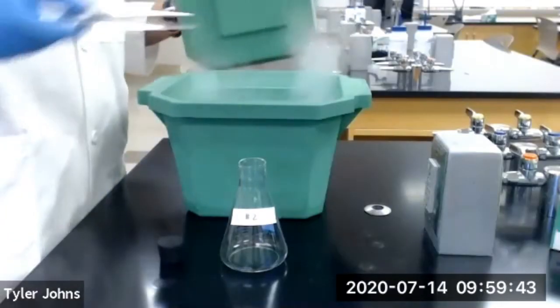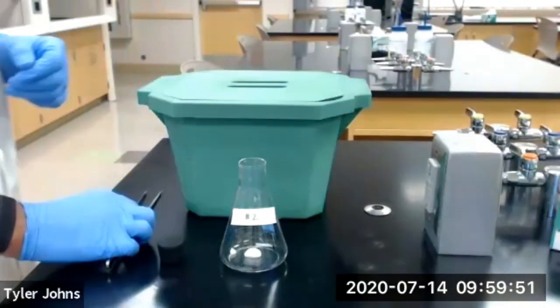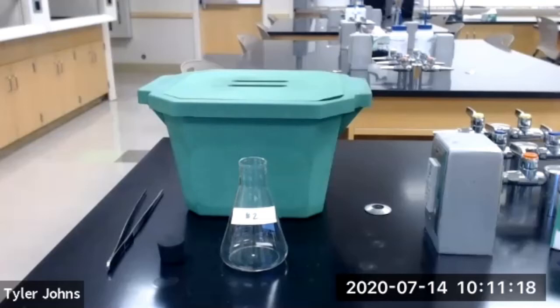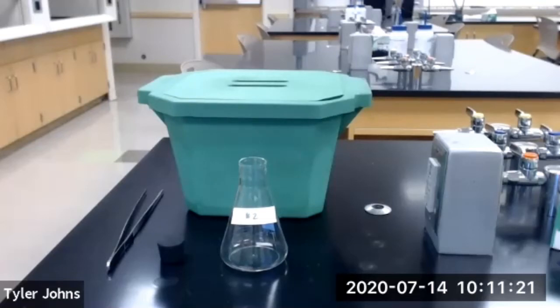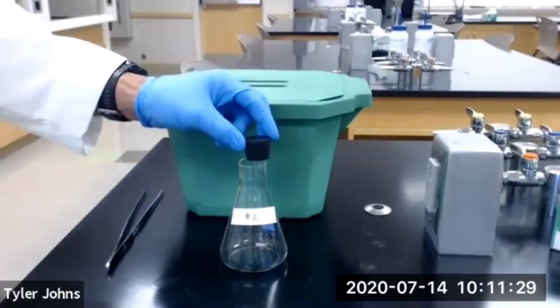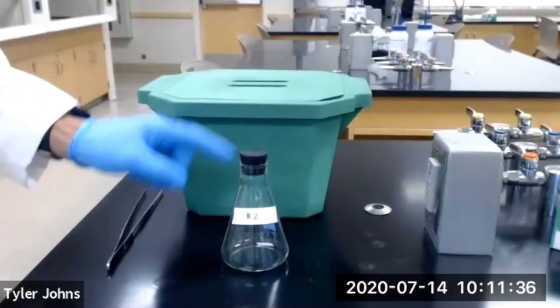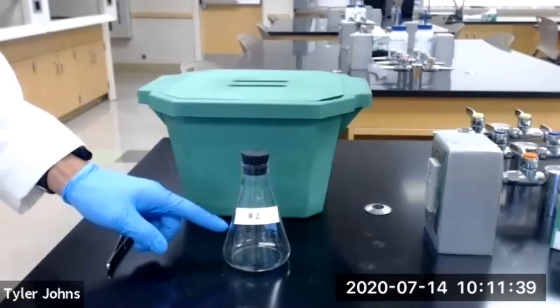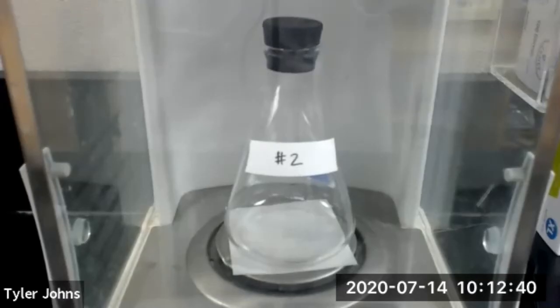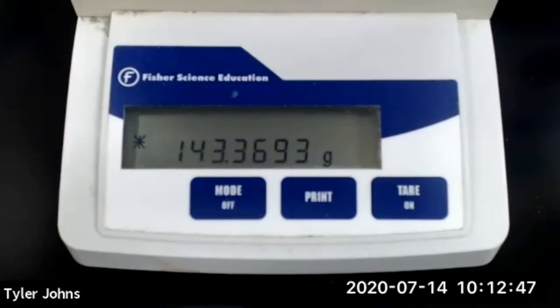We'll next add our small piece of dry ice and allow it to sublime in our flask. Our dry ice has now completely sublimed, so we're going to stopper the flask and determine the mass of the Erlenmeyer flask, the stopper, and the carbon dioxide gas inside. The mass of our Erlenmeyer flask, the stopper, and the carbon dioxide gas for trial number two is 143.3693 grams.